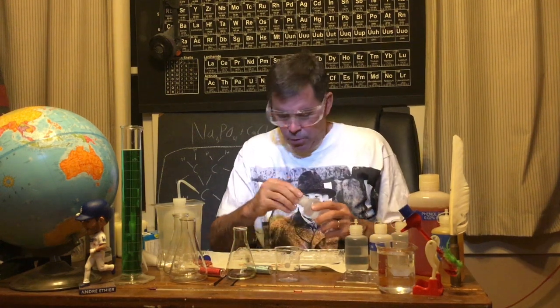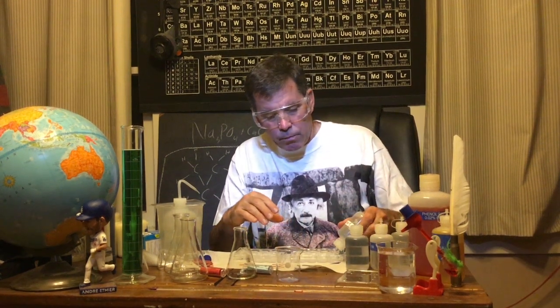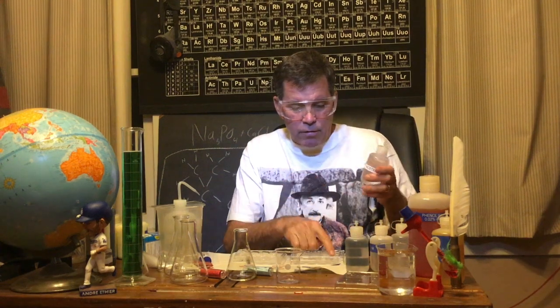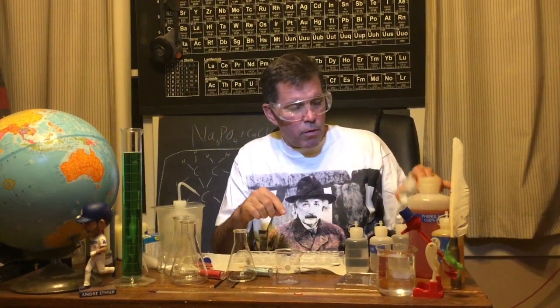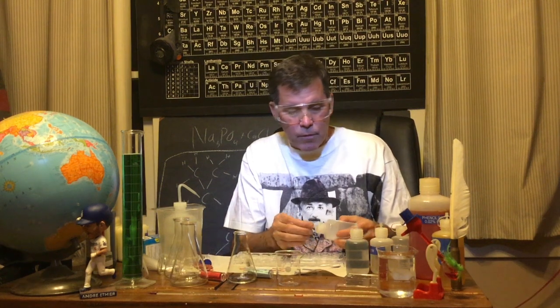So first I'm going to put some acetic acid in this spot plate so I have it available. So acetic acid's in well 1, you'll need to remember that. And then hydrochloric acid, you remember how those two acids are different? And the third one, sodium chloride.